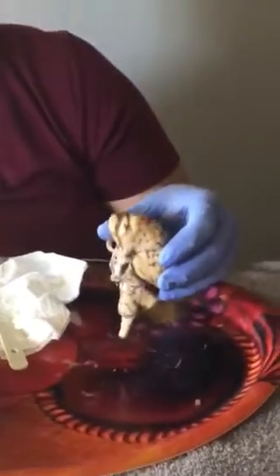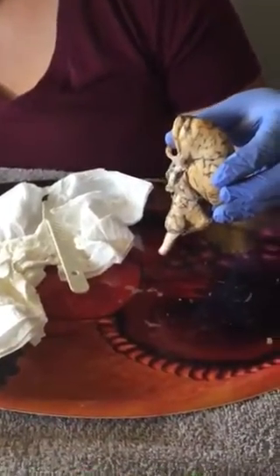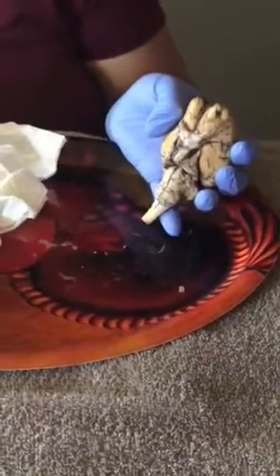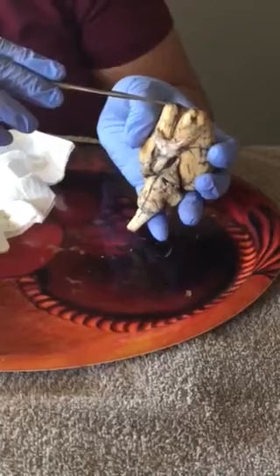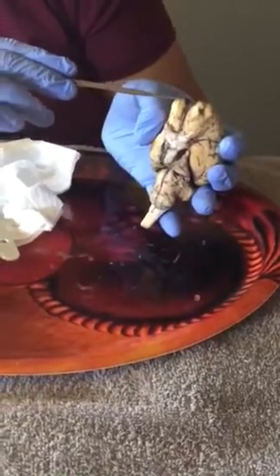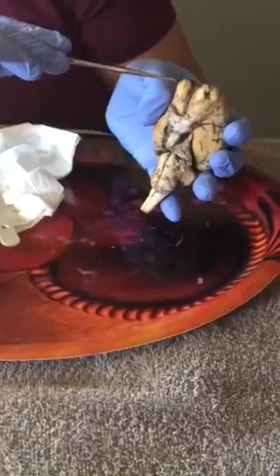Next, I will be going over the ventral surface. I'm pointing out what the olfactory bulb is. And for that, I'm going to go ahead and face this up like this. So the olfactory bulb is the very top of this here. To me it looks like an alien, and these are like the big eyes of the alien, the very top of the eye. That's the olfactory bulb. We also have the olfactory tract.